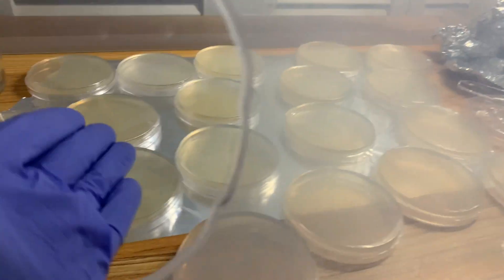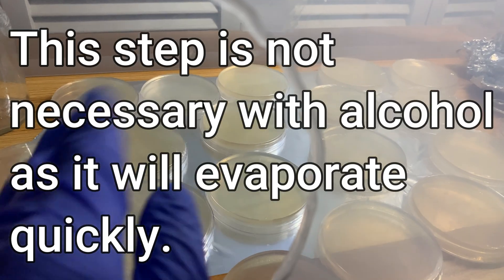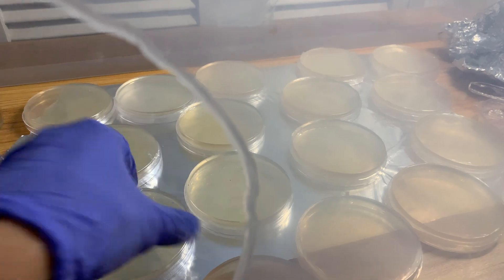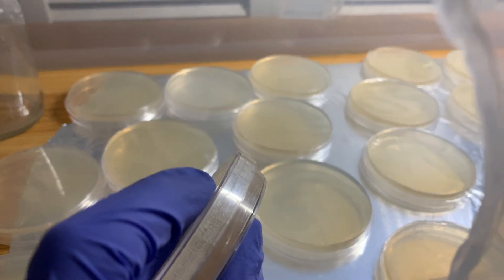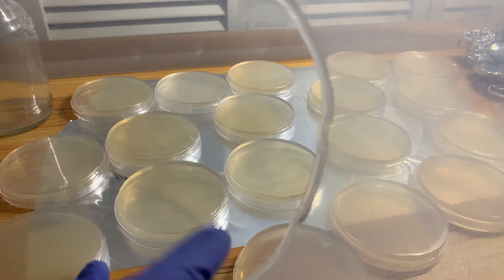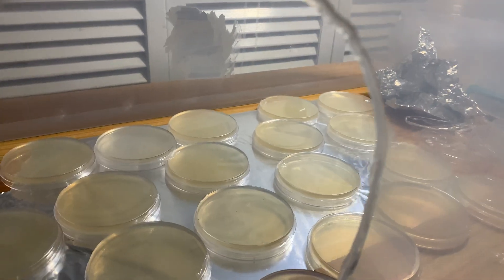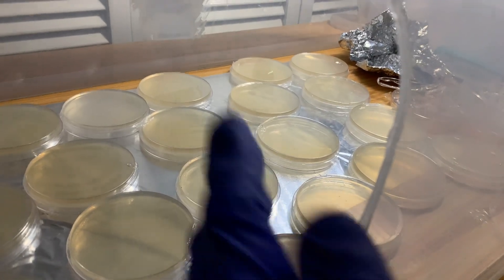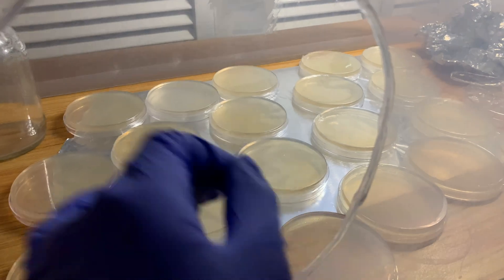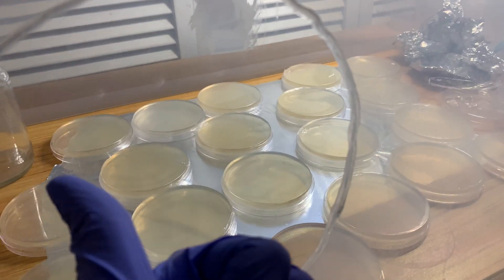I put them out like this so they could dry afterwards. After wrapping them up I left them to dry for a couple of hours, then the next morning I flipped them around so the bottom could dry too — I don't want any hypochlorous seeping through the seal, which can happen. So far so good, but it's only been a day and a half. Over the coming days I want to see if we get any contamination, and whether it's worthwhile to save old plates this way.